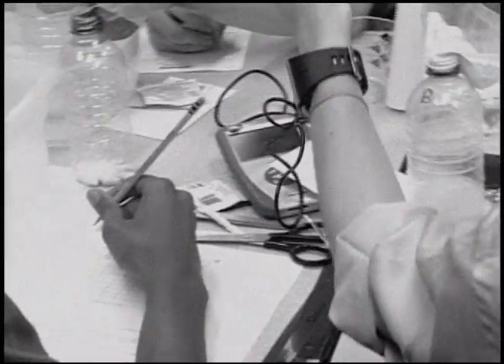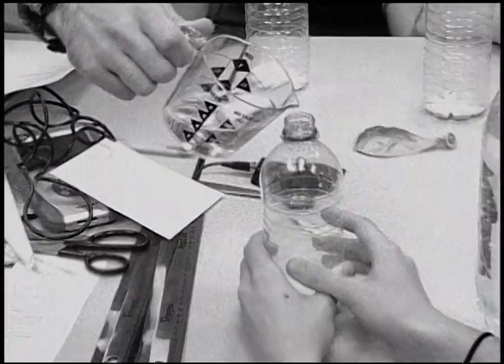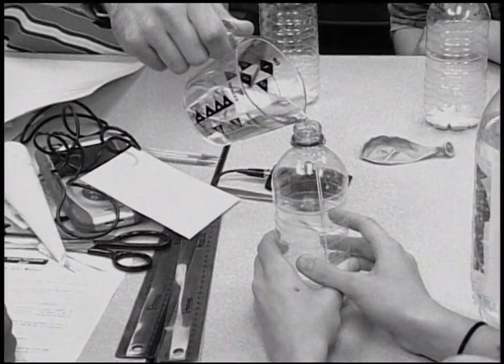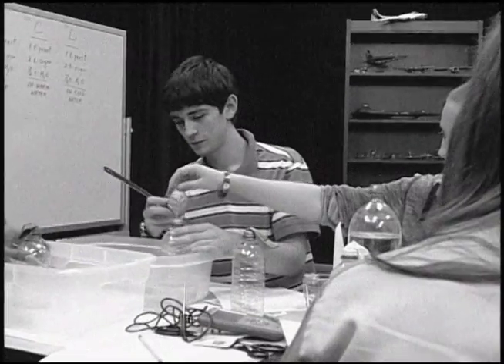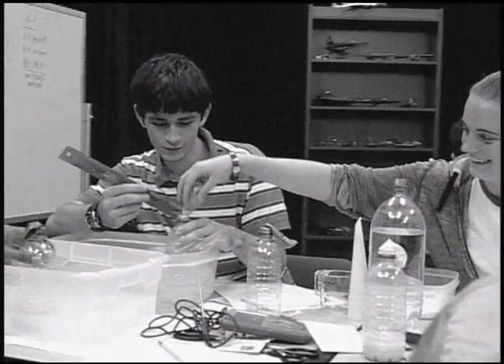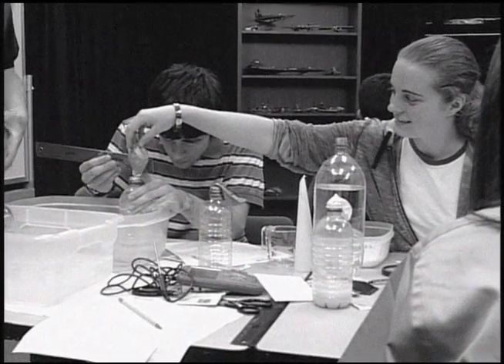We want to be sure that when we add the water to each of these, the reaction is going to start, hopefully. So we want to get a way to measure the gas. And how are we going to measure the gas today? What are we going to look at? The inflation of the balloon. Inflation of the balloon, right. Tony's going to say the same thing. We've got the balloon inflation, right?